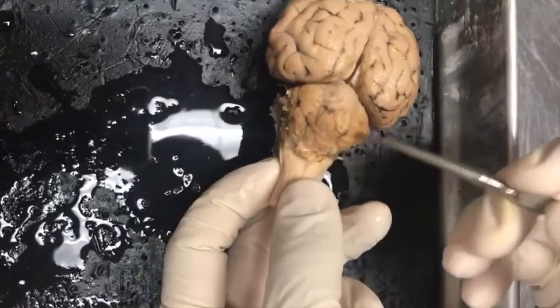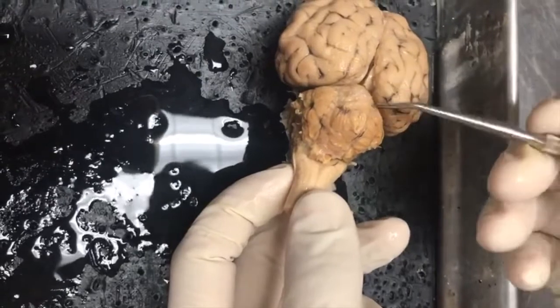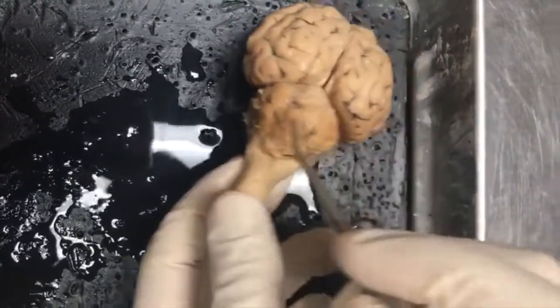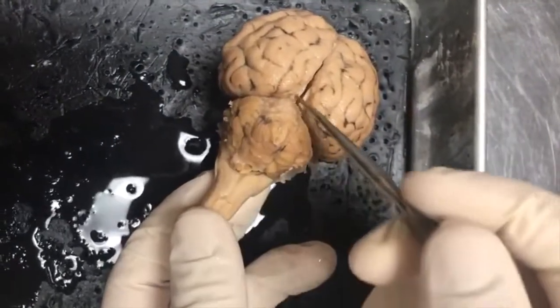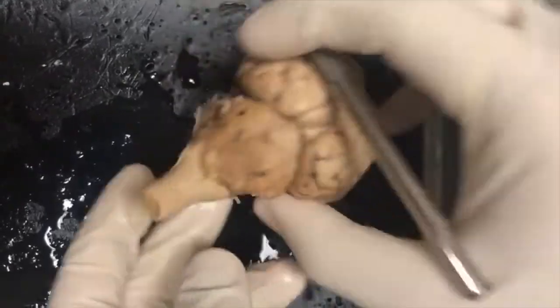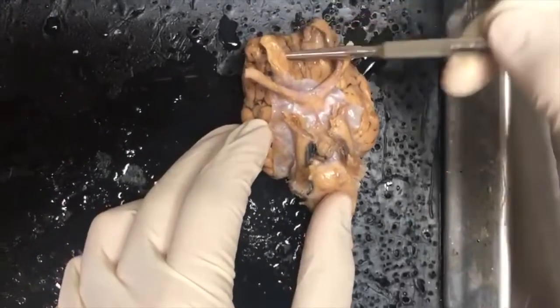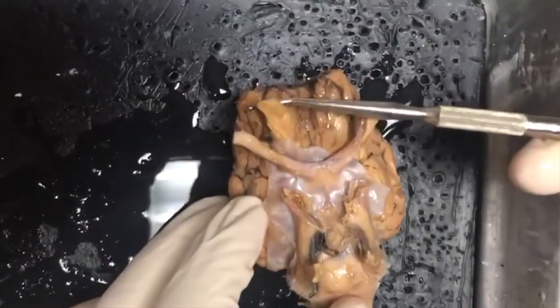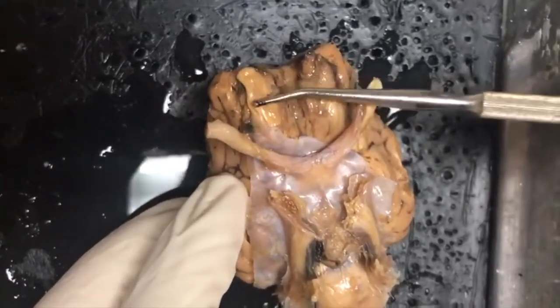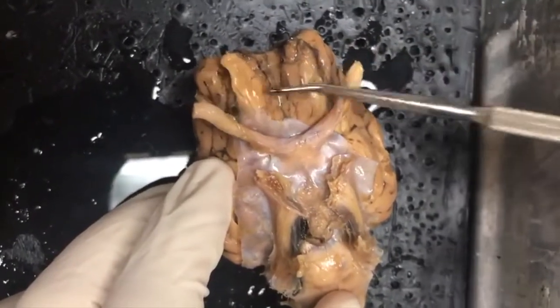Continuing going back, you have the cerebellum, primary function being balance and coordination. You have two lateral hemispheres, and in the middle you have the vermis. And that's it for the top part, superior view. So now if we go to inferior view, you look towards the front and you have cranial nerve number 1. So this is your olfactory bulb or olfactory nerve, and it's responsible for olfaction, which means smelling.